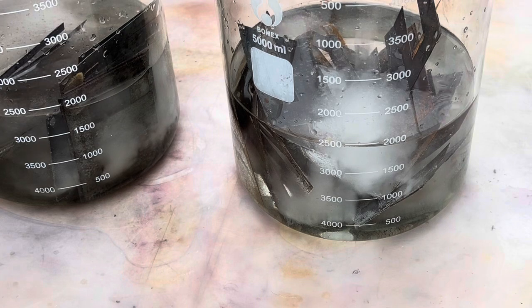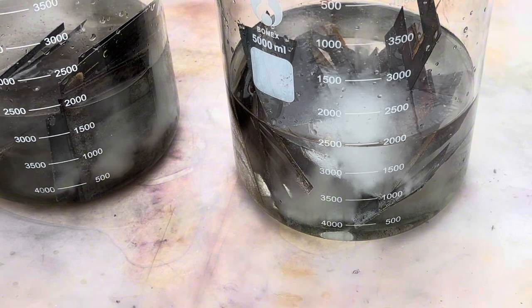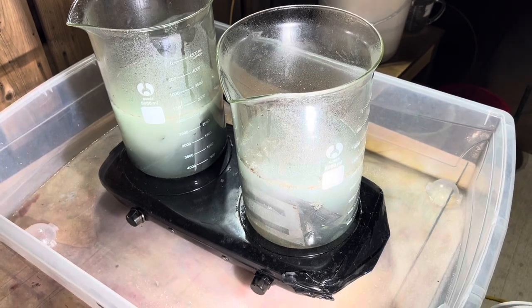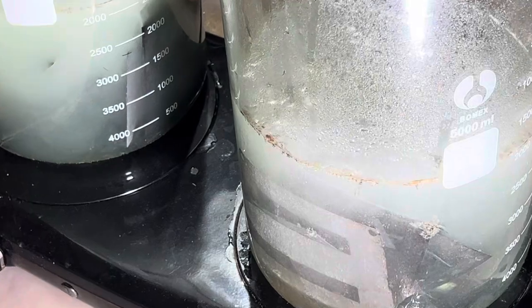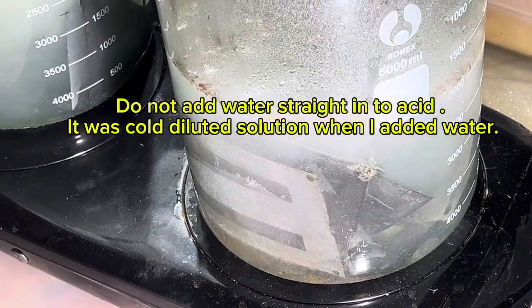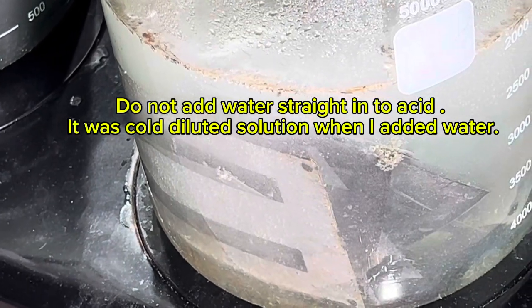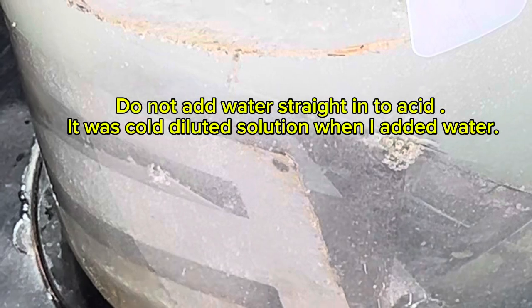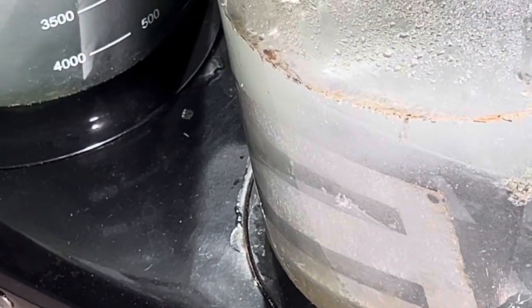The solution and the reaction are going — I'm going to let it be until the reaction is done, then maybe put it on heat. That's my plan. Later that night, I added a little more water and a few mLs of sulfuric acid and put it on the heat.